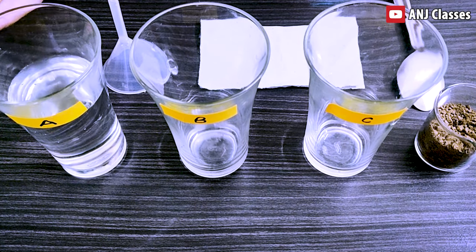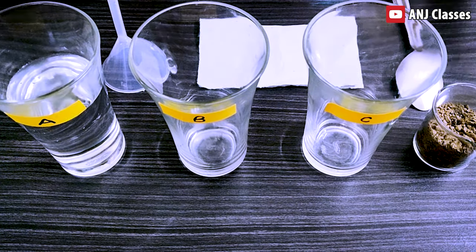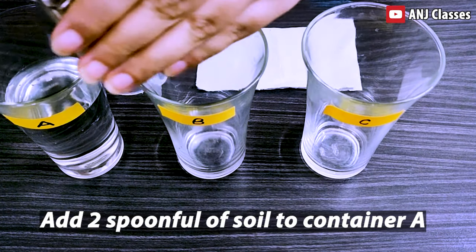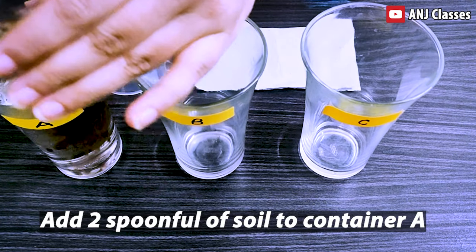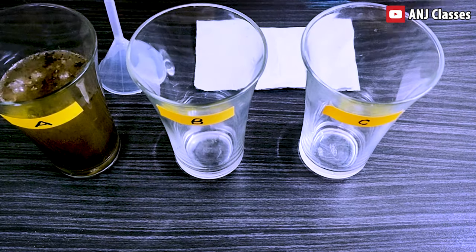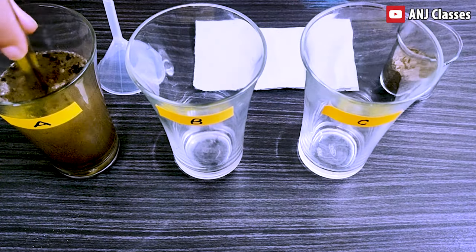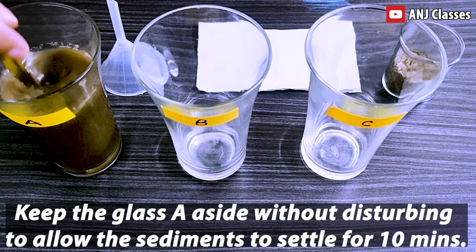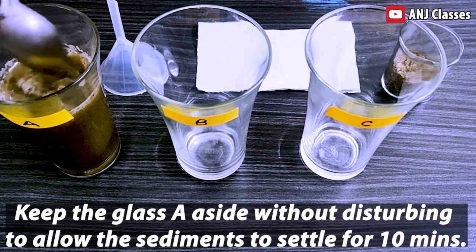Let's start this activity. First we will add two spoonfuls of soil to glass A. We will mix it and keep it aside without disturbing for ten minutes.